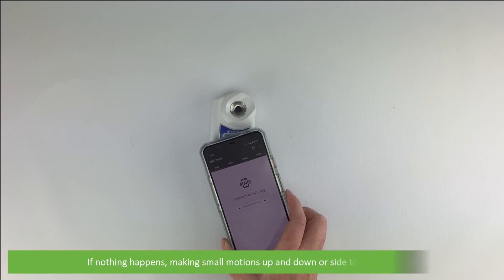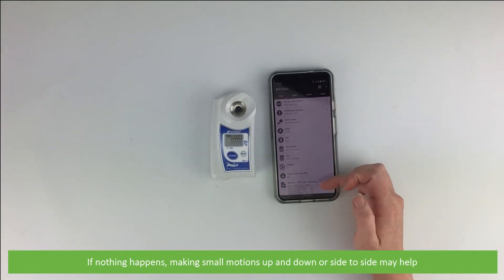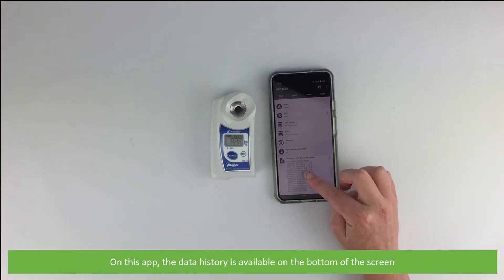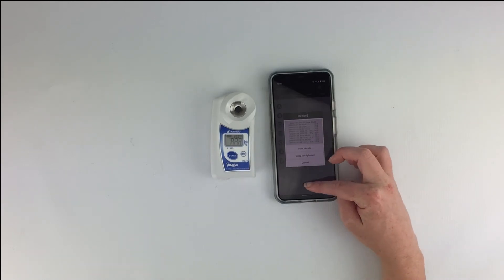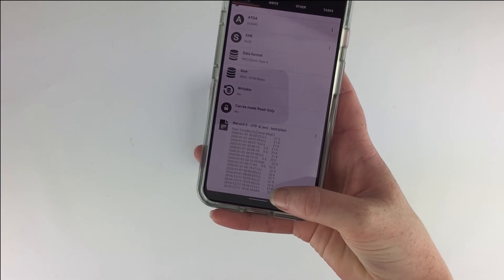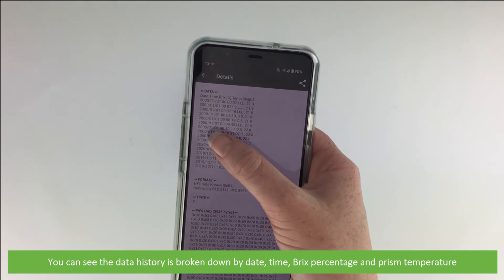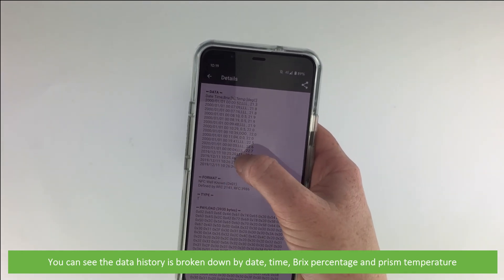If nothing happens, making small motions up and down or side to side may help. On this app the data history is available on the bottom of the screen. You can see this data history is broken down by date, time, brix percentage result and the prism temperature.